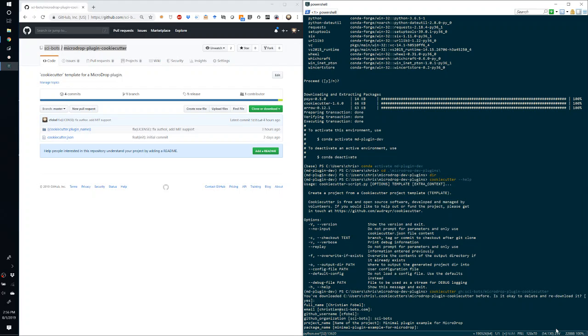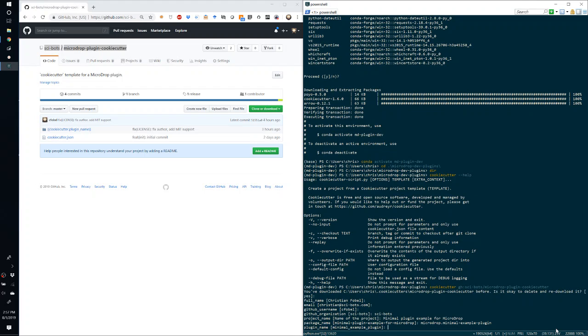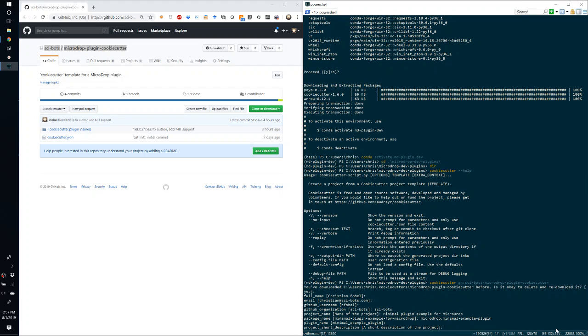And then we want to give it a package name. The convention that we've been using for microdrop packages, or microdrop plugins, is microdrop dot, and then the name of the plugin after that. So dot, and then we can say minimal example plugin. The plugin name is the next thing, which is automatically derived from the package name, or you can specify it explicitly. But this plugin name must be a valid Python module name, because this is what will be imported. And so minimal_example_plugin is a valid Python module name, so we'll just accept the default.